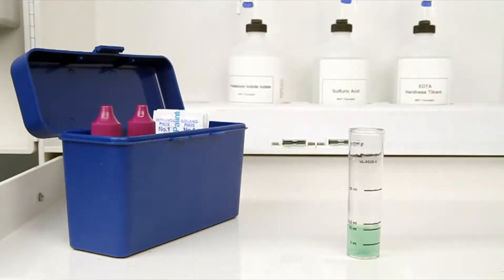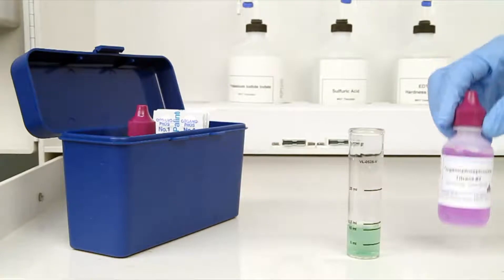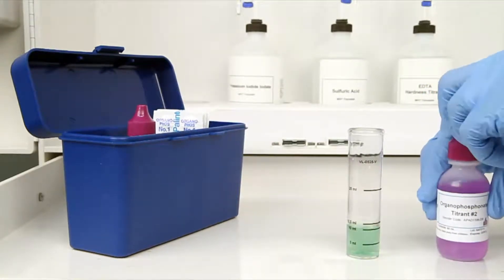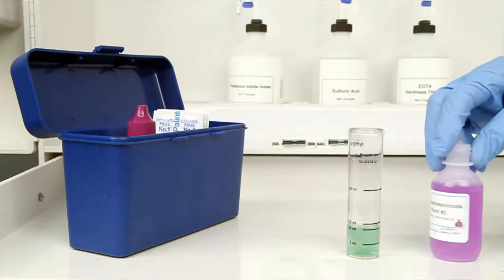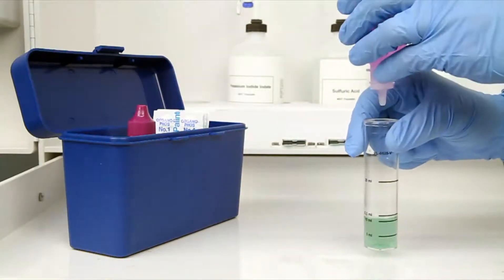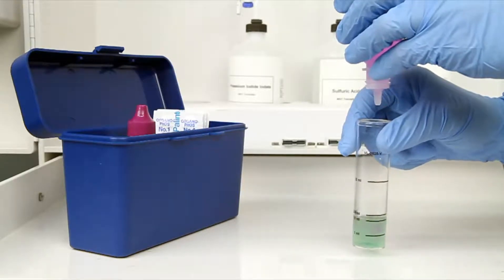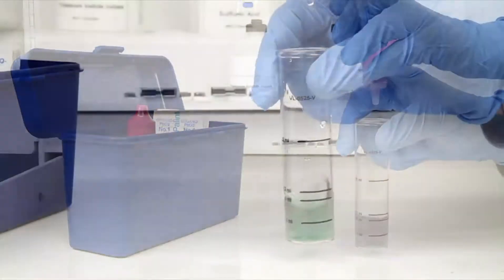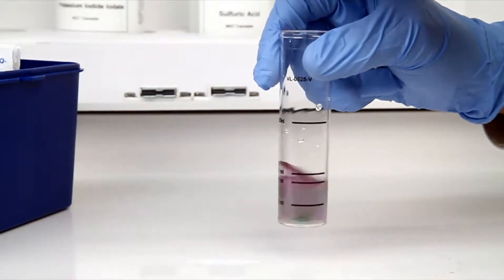The next step according to the Endpoint ID procedure is to perform the titration. Each bottle of titrant is labeled with the equivalency and sample size it was manufactured for. It's important to make sure you have the proper titrant and the proper sample size for this titration. The bottle of titrant contains a dropper tip, so it's important to hold the bottle vertically to make sure you get a consistent drop size.